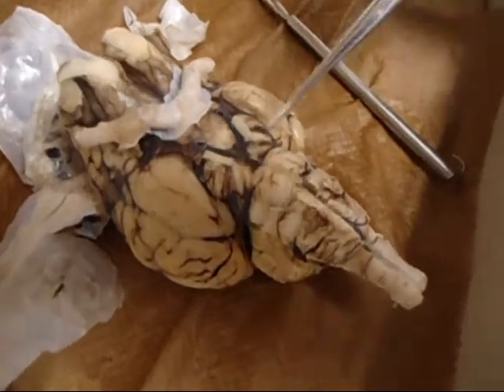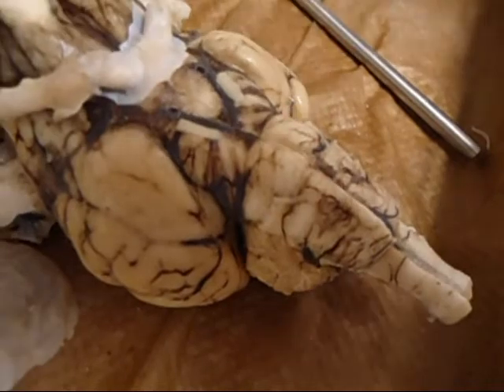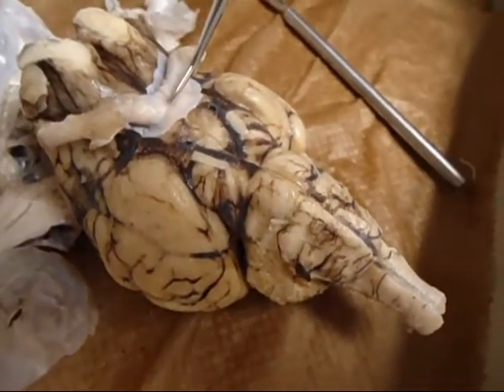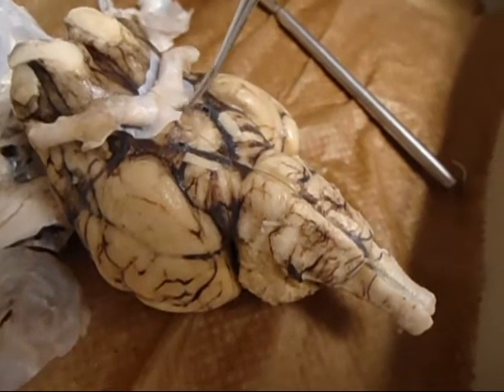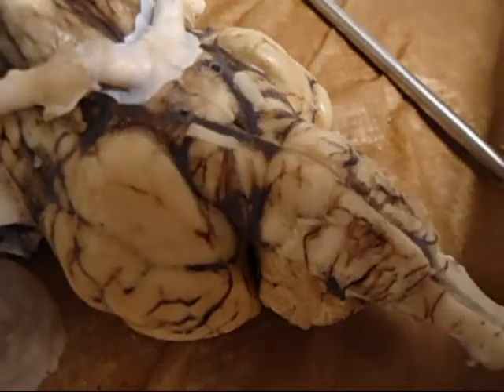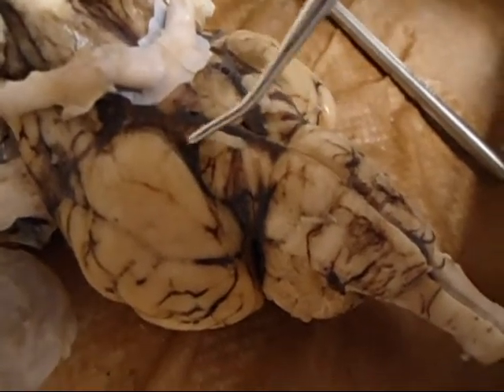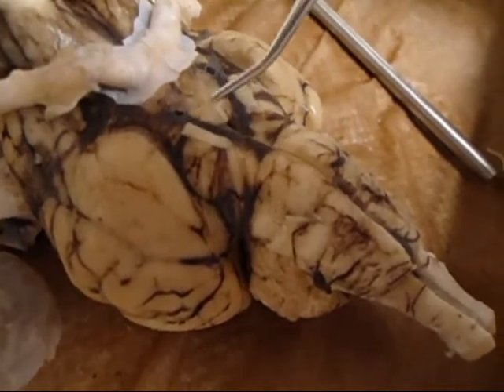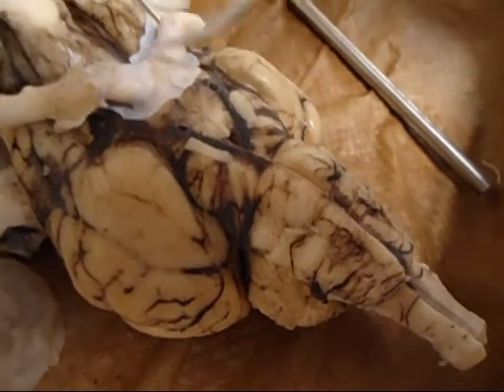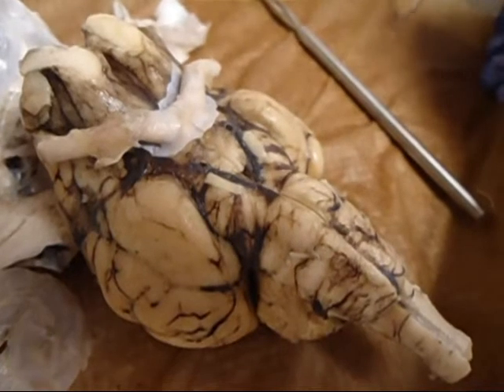The cerebral peduncles are these two lumpy masses right before the pons, in between the pons and the optic chiasm. The hypothalamus and the mammillary bodies are here, and that's between the V. The V is the cerebral peduncle. The mammillary body is in between the V. Hypothalamus is just above it. And then your optic chiasm is in the middle. And we can remember it by OHM, O-H-M.